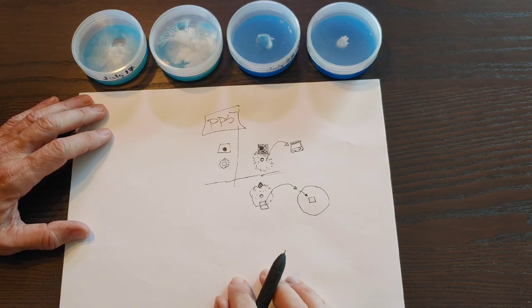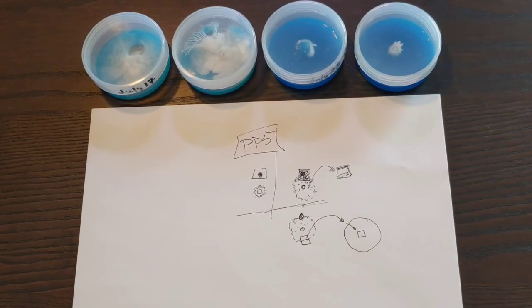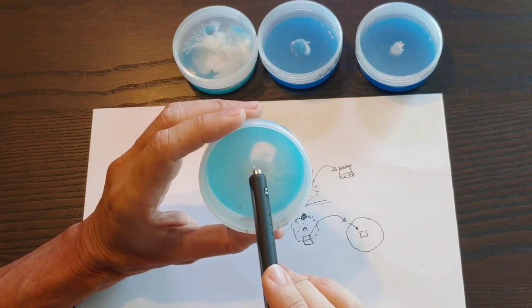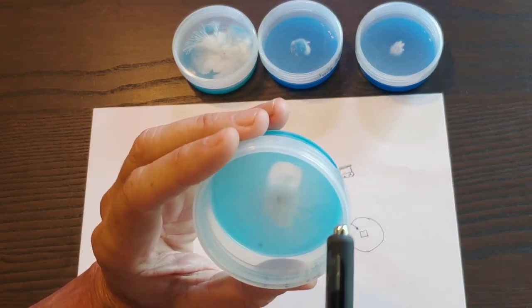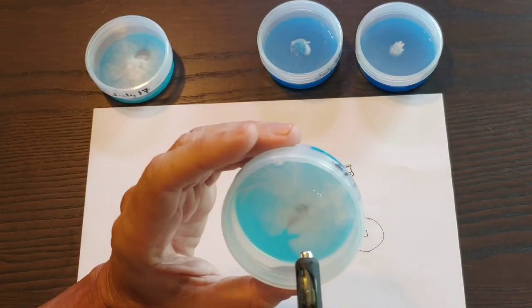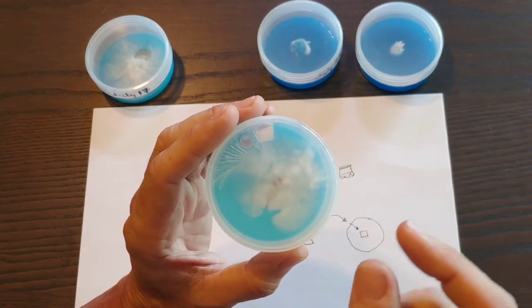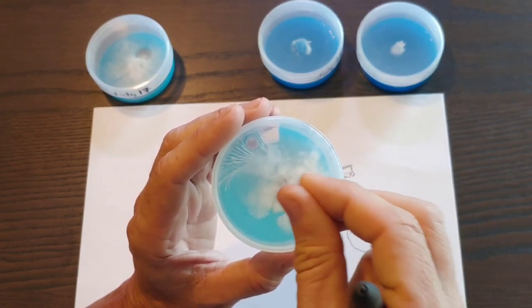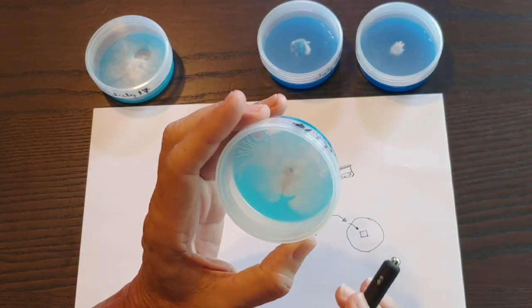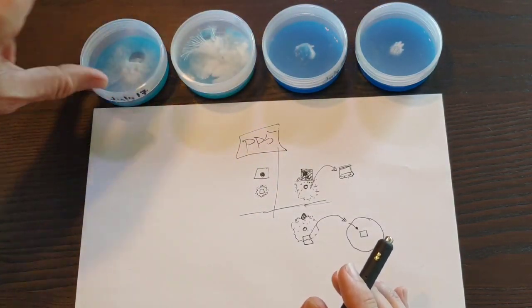So that's it. Those are some pointers about doing agar transfers and agar work and that type of thing. One last thing is that you can use tissue from your mushroom to start your mycelium growth, or you could use spores like we saw in the other video, spores to agar. Also, you could use a spore syringe and put just a drop or two and start from there, or a liquid culture syringe and do that as well. There's many ways you can use that agar, and we'll be posting more and more videos on this because it's important to learn agar.